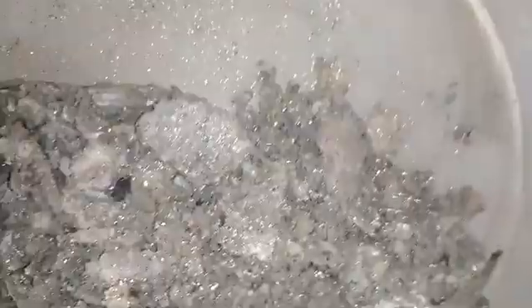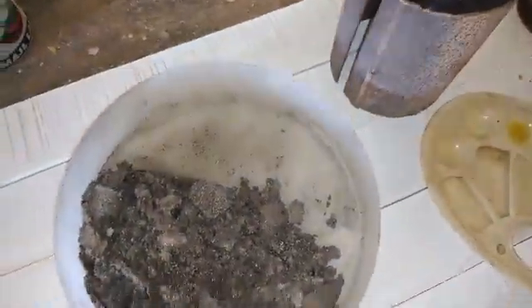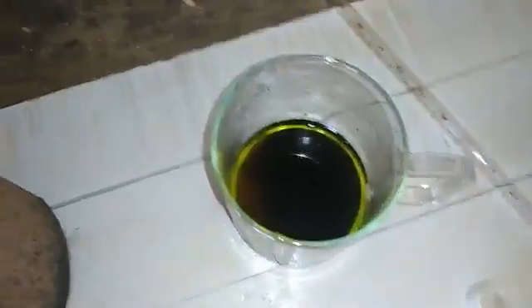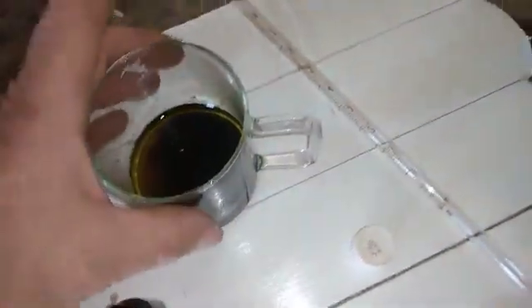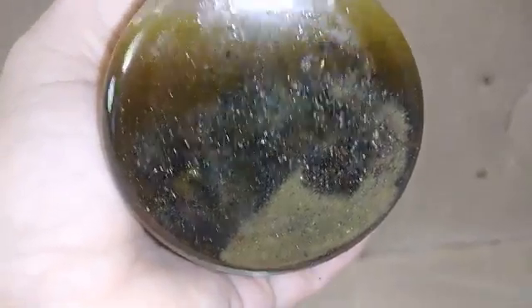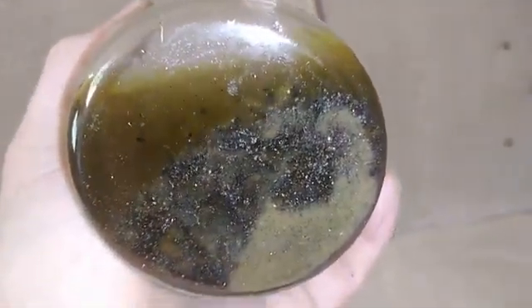My third test was to put that in aqua regia. This is my aqua regia. After boiling that on heat for maybe a half hour, you can see — the flakes are still here. These flakes did not dissolve in the hot aqua regia.